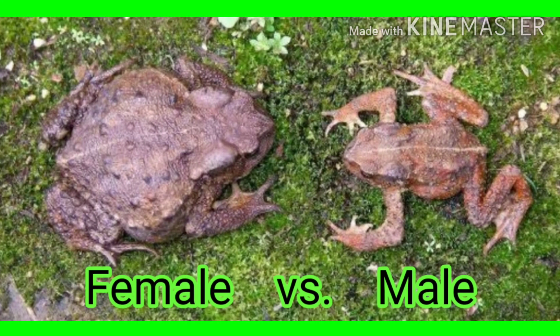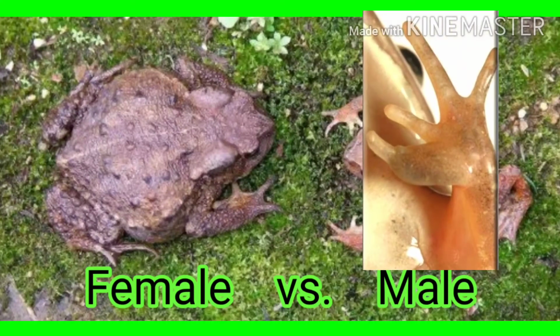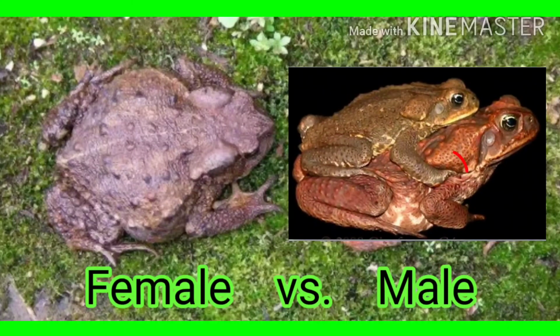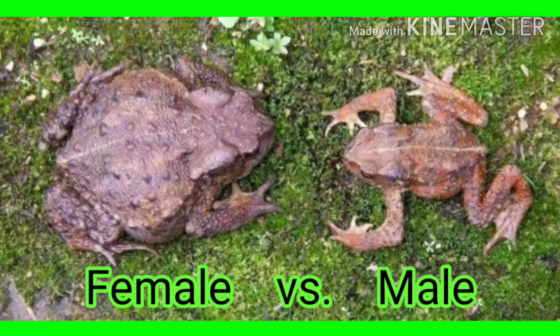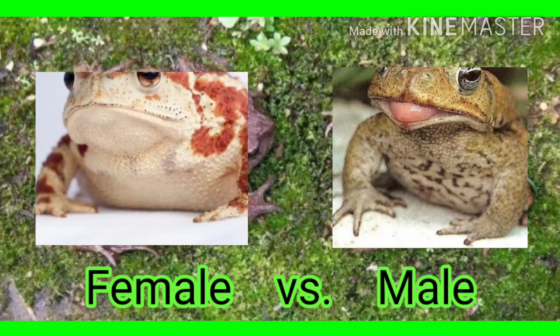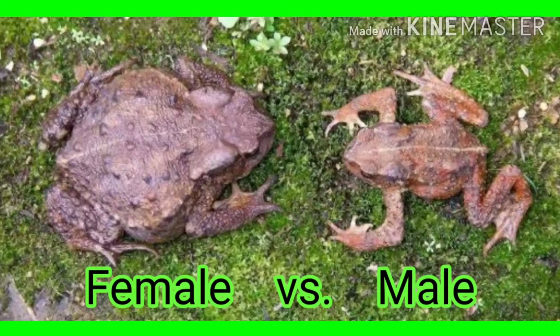There are also features in which we can distinguish the sex of a toad. If the first finger of the toad is swollen and enlarged, it is a male toad, since during breeding season, they use their thumbs to grasp females during amplexus, or their mating position. The male also has dark pigmented areas at the angles of the lower jaws on the ventral surface of the head. Lastly, females are generally bigger than males.